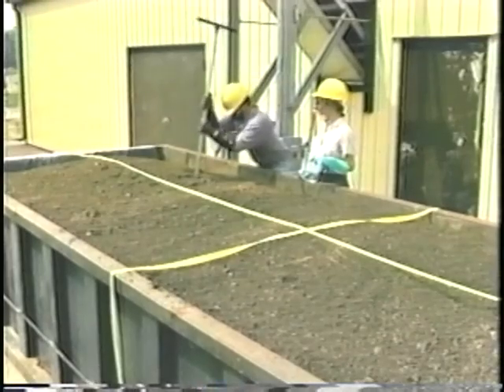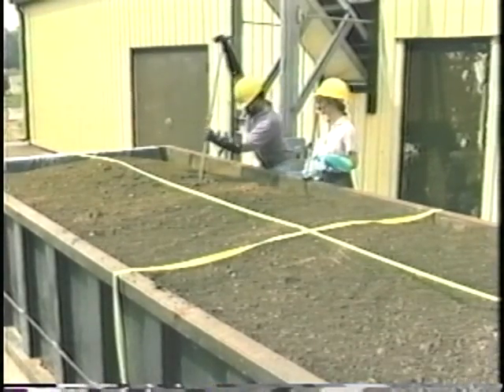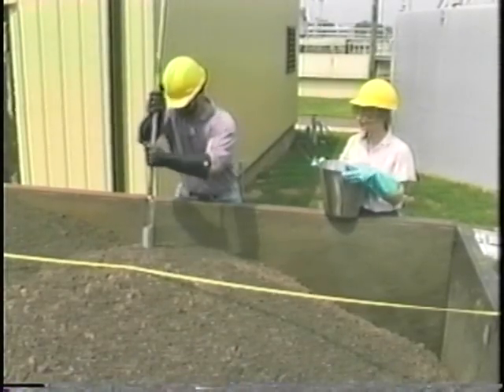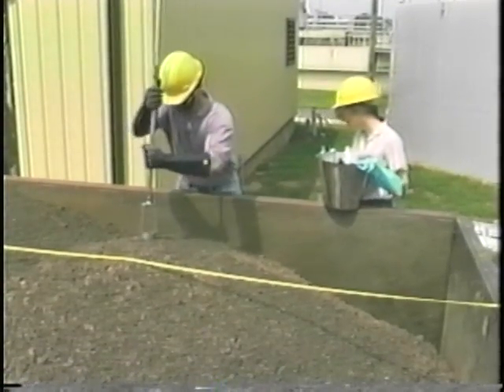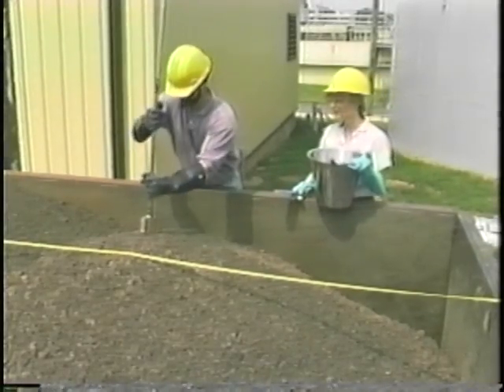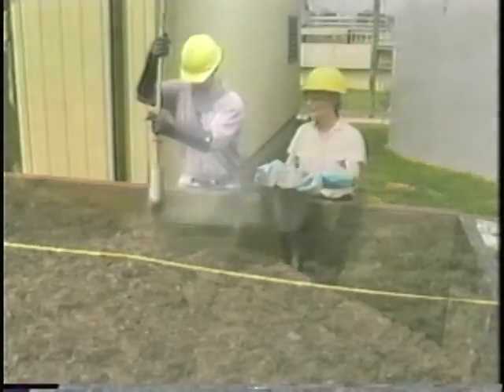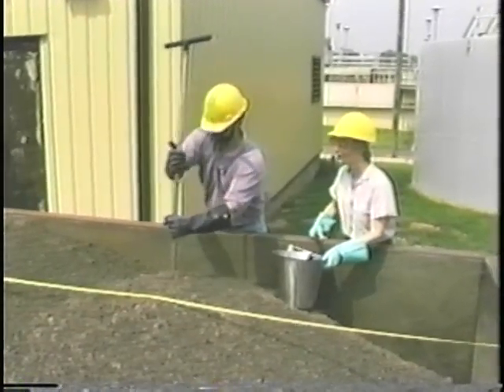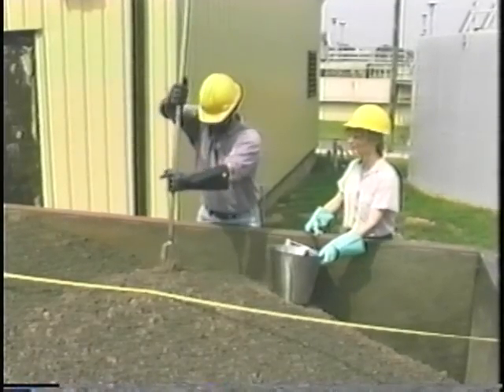Using a coring device, take a full core from the center of each quadrant in the bin. To use the coring device correctly, position the coring device, press and twist down into the sludge, twist and remove. Repeat until you reach the bottom of the bin. If you are sampling from a drying bed, take care not to get too much sand in the sample.